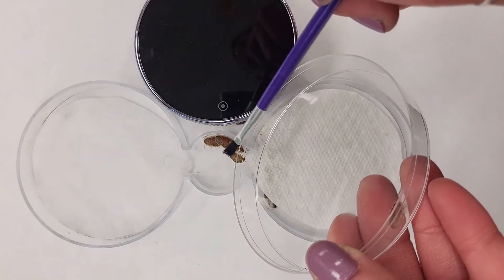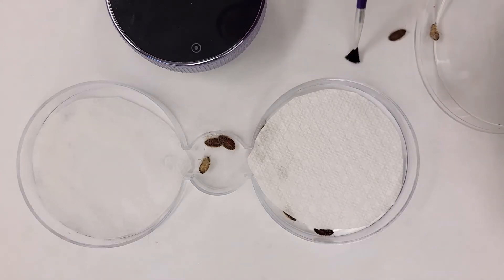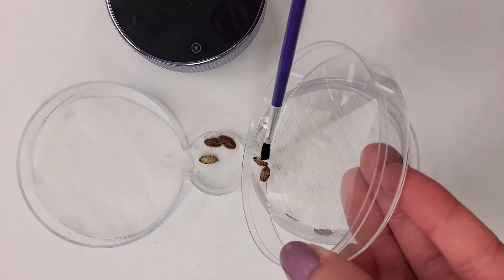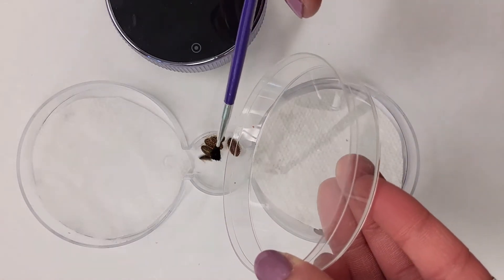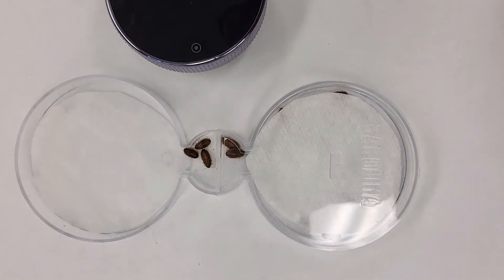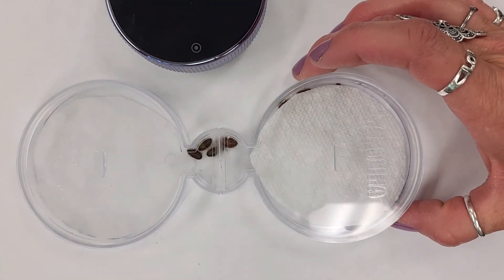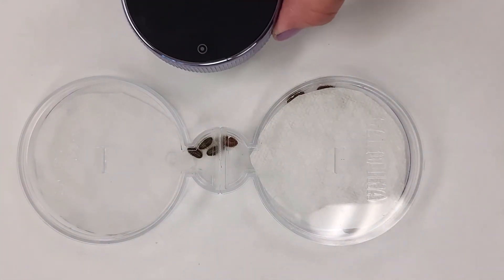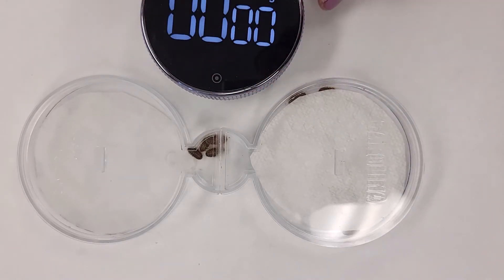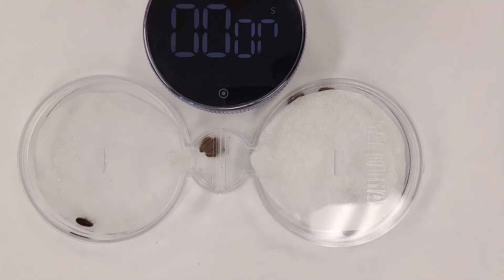Okay, I've got an escapee — let's put this guy back. So I've got 10 bugs and I've got these nice little lids. What we're going to do is record how many bugs are on each side for 10 minutes, recording our data every 30 seconds. I'm going to put a timer on and we're going to leave this paper towel dry and put the bugs in the middle.